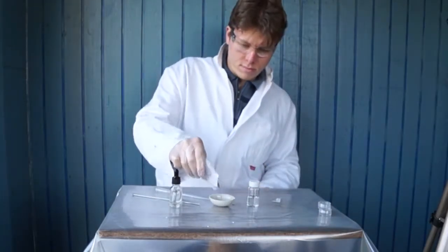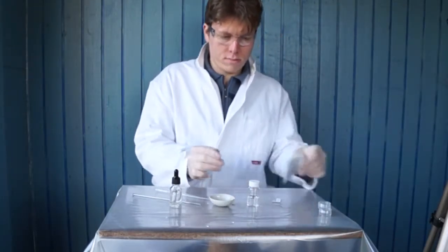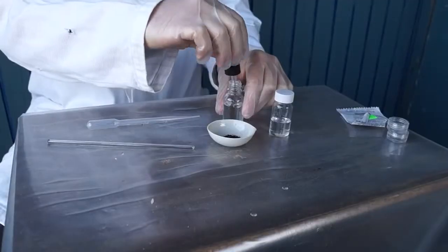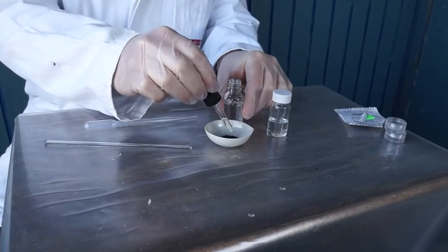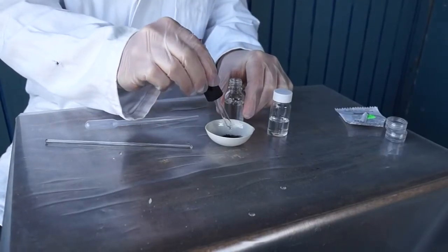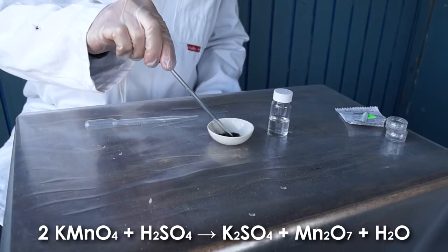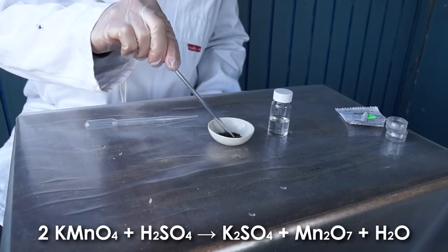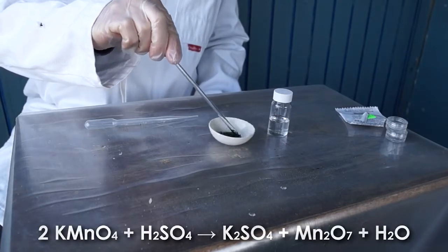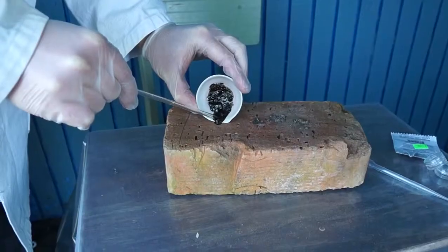Firstly, let's put some potassium permanganate into our evaporation bowl and add several sulfuric acid drops. After a while, the strong oxidizer manganese oxide 7 is formed from potassium permanganate.